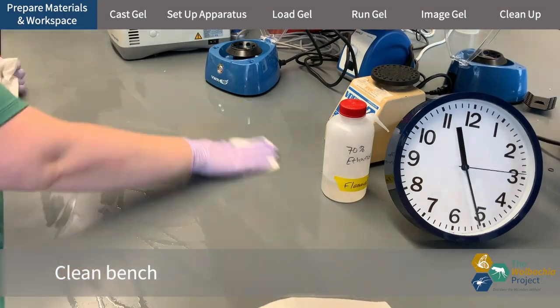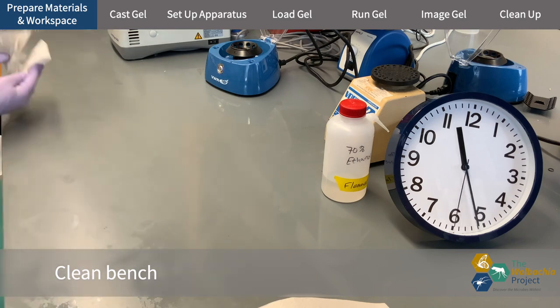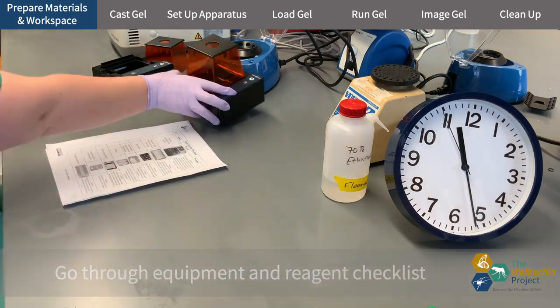I start by putting on gloves and cleaning my lab bench. Then I go through the equipment and reagent checklist.